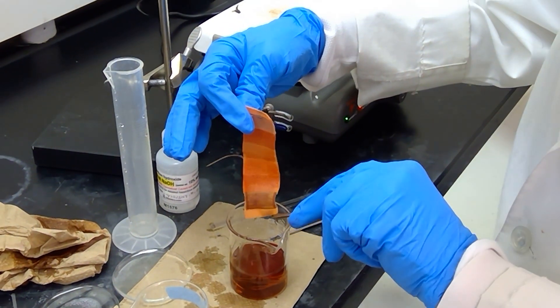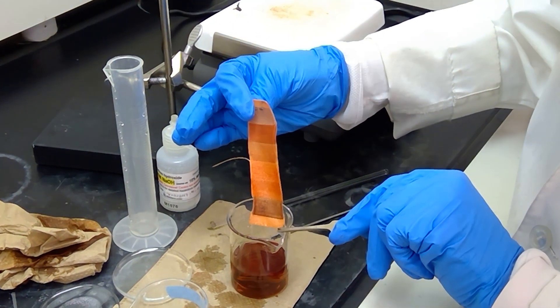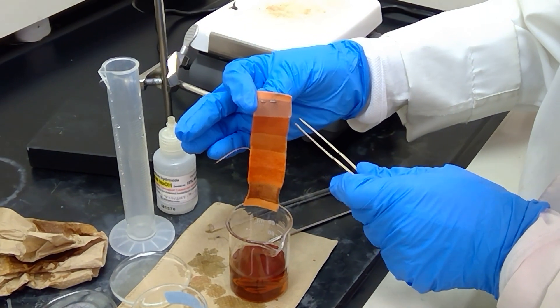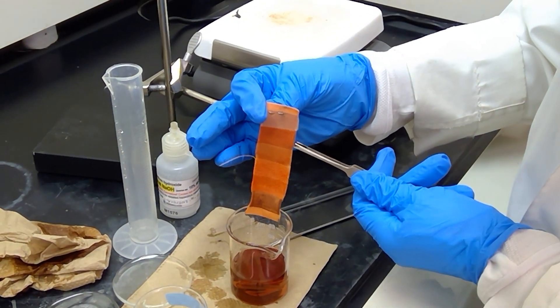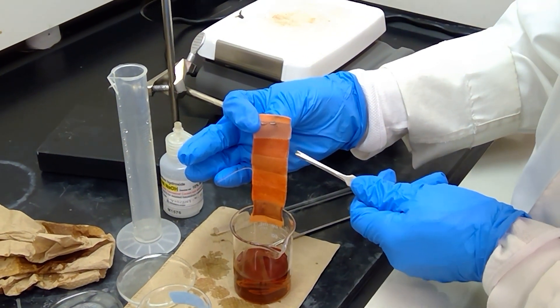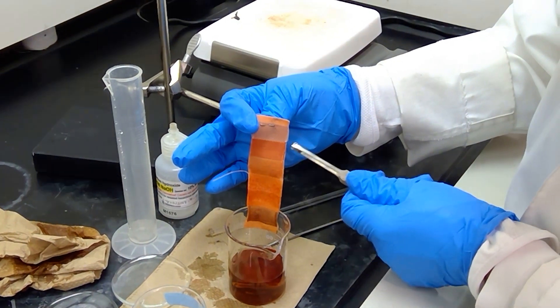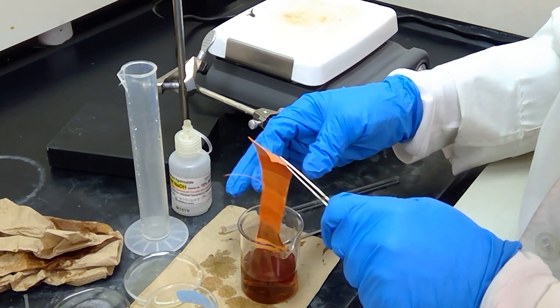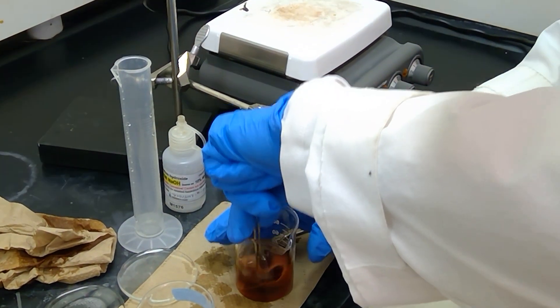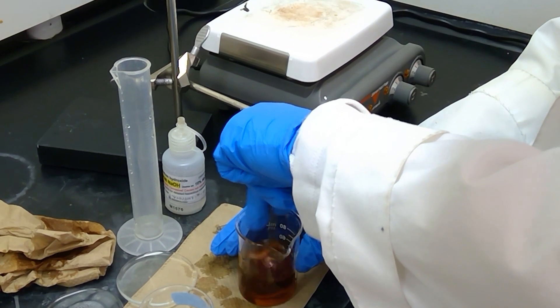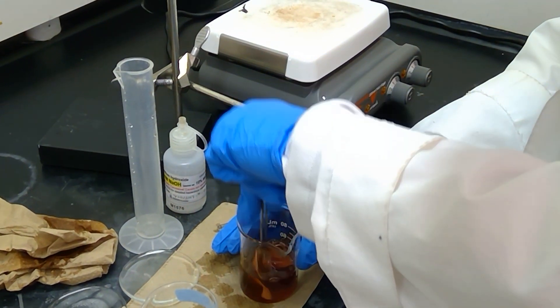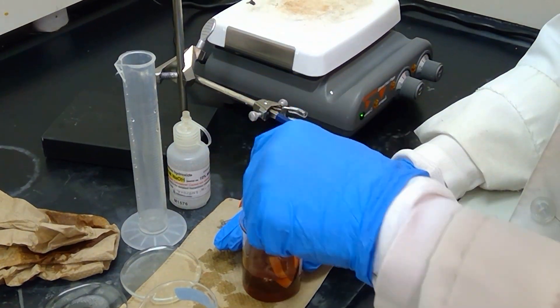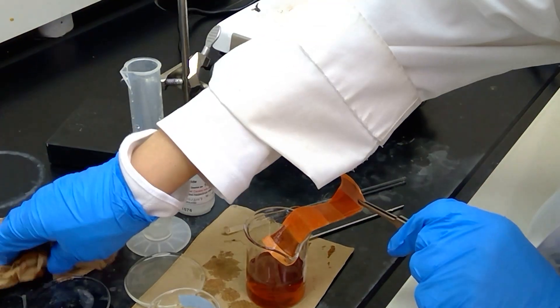So down here we have wool, and up here we have cotton, and I believe cotton is probably the closest in color to what we would consider red. But the other fibers are pretty much an orange-ish color, and let me dunk it again to try to increase the adhesion. And for this one, we don't want to leave it too long in the hydroxide solution.